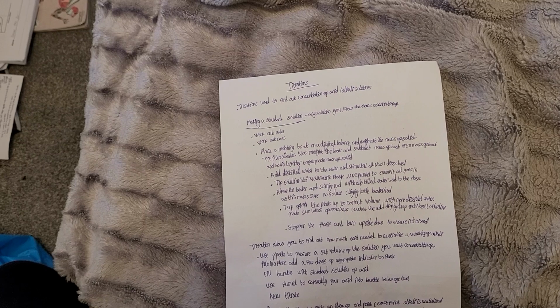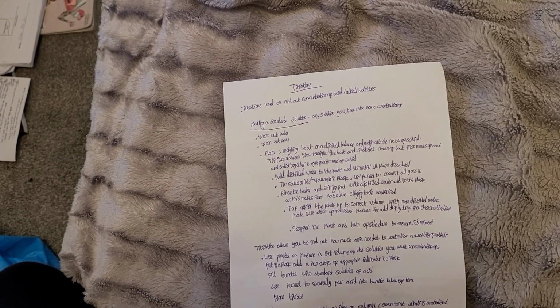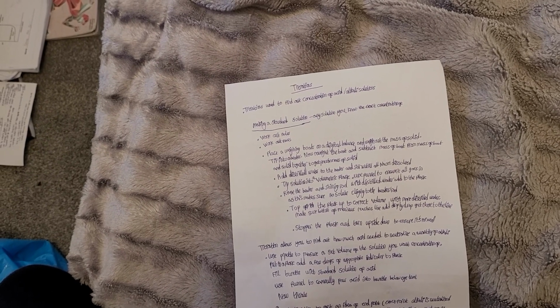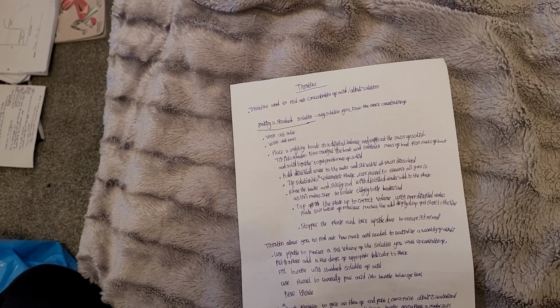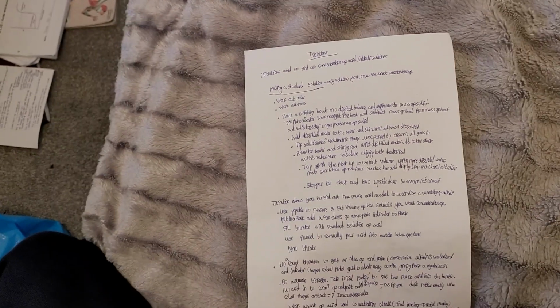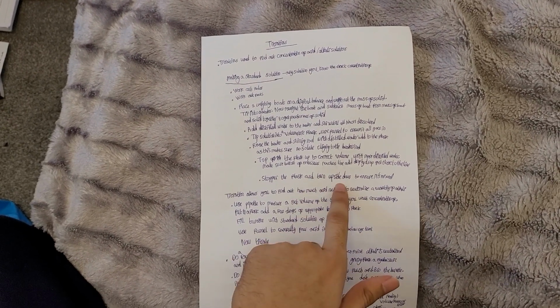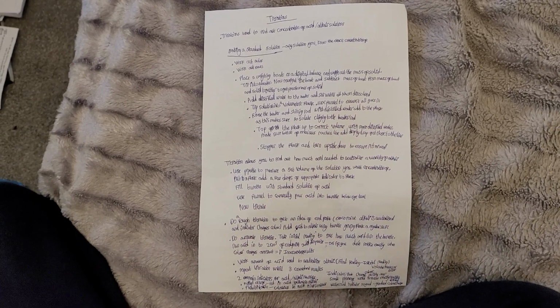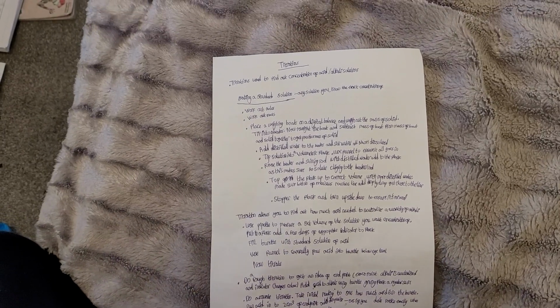Top the flask up to the correct volume with more distilled water. Make sure the bottom of the meniscus reaches the line, and add drop by drop when you get close to the line. Stopper the flask and turn it upside down to ensure it's mixed. In the exam, they can do one-markers like, why do we turn it upside down? It's usually just these one-markers, and it depends how well you know the practical.